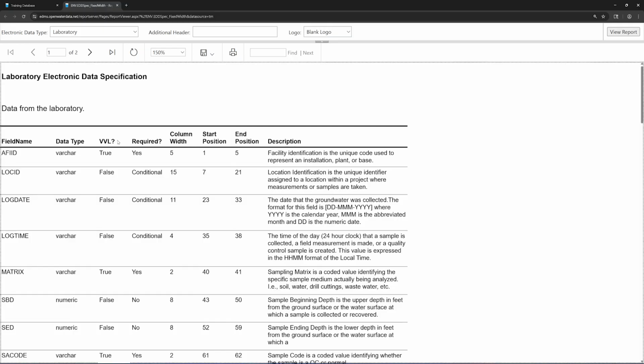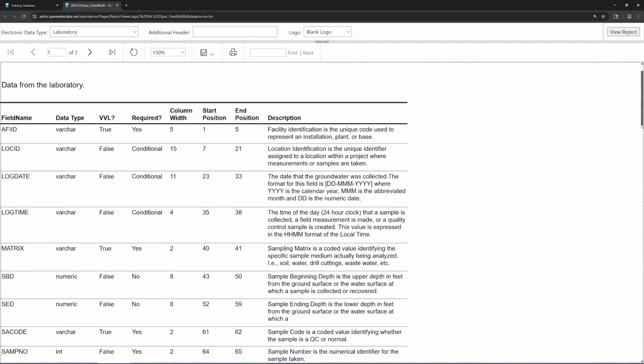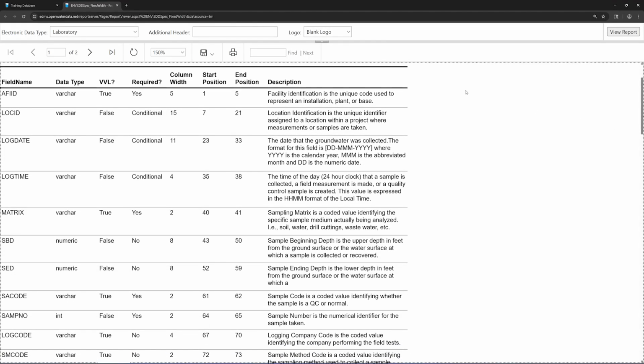VVL: whether the field requires a valid value. Required: whether the field is required to be populated or can be left blank. Column width: the number of characters allowed for the field. Start and end position: where each column starts and ends in a fixed width file. Description: what the field actually contains. To prepare a spreadsheet for our data, we would name each column after the field names listed in the data specification.